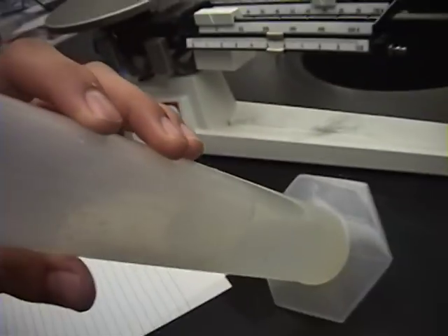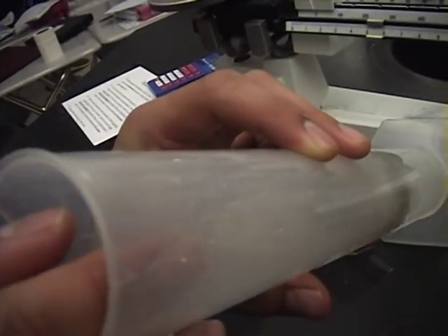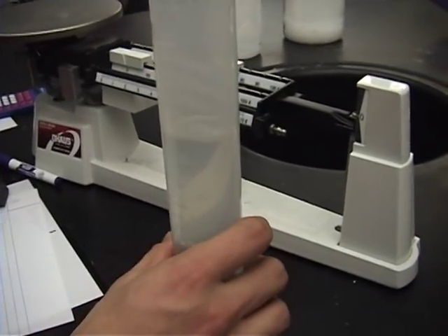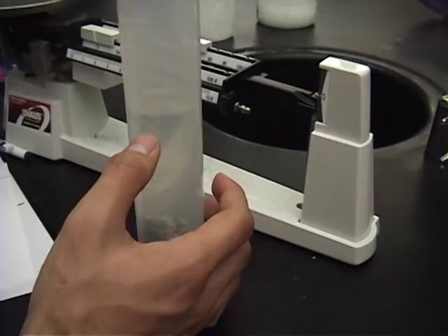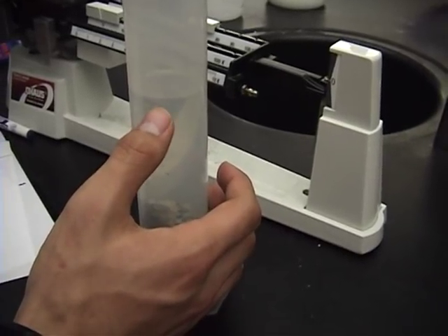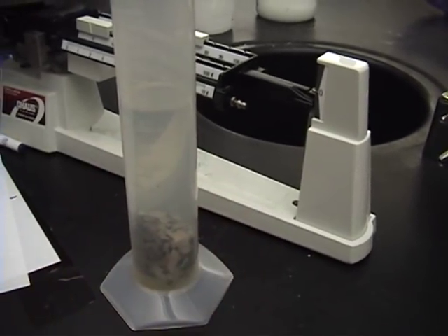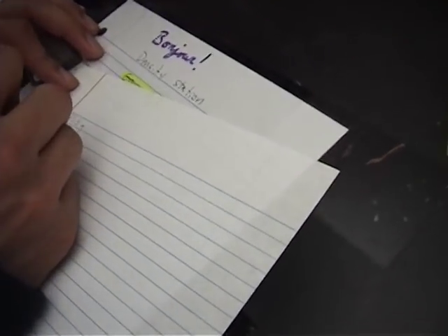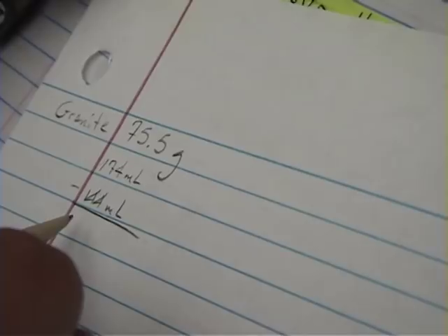Okay. So you have to slide it in and just throw it in there. So, like that. And then you have to get the second measurement. And you subtract the first measurement from the second one. And that'll be like, thirty milliliters. So the volume is thirty.